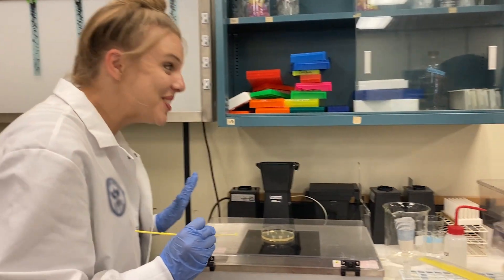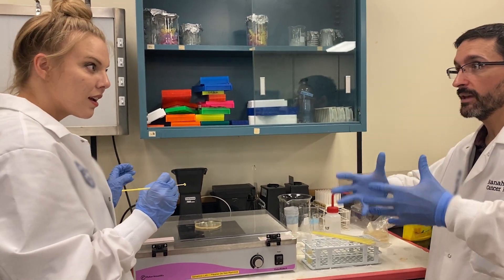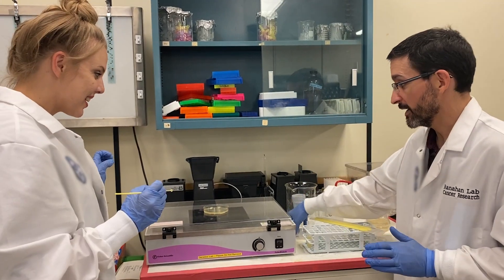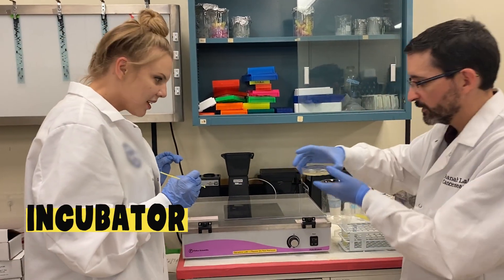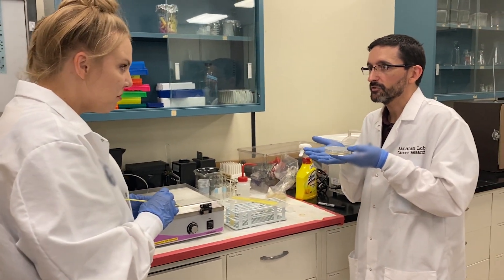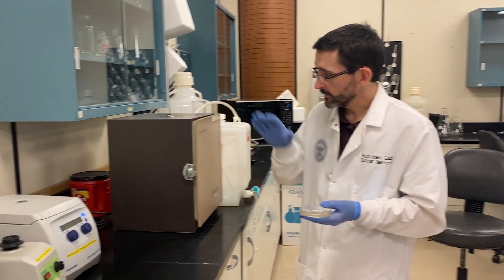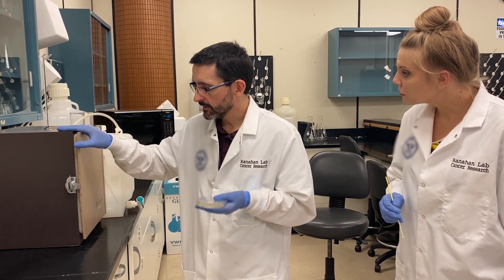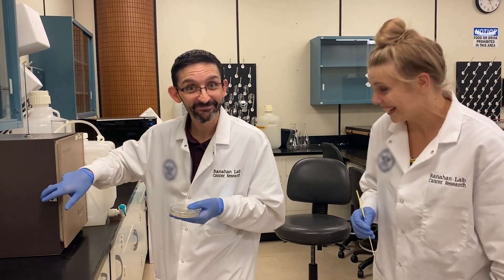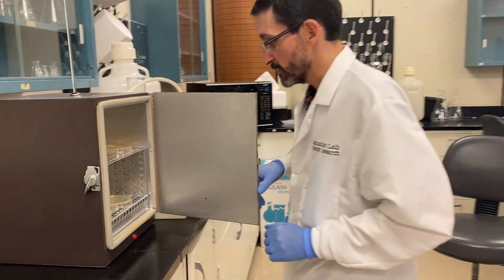Now they're going to grow, and then we'll make them glow. I think I'm done. What do we do now? Now we're going to let the cells grow. They replicate more of that DNA so it's nice and bright when we look at it. So now we've sent them in the incubator. We put the little cap on. It's kind of crazy, but we're going to flip it upside down, because they like it that way. So here is our incubator, and it's going to keep these cells nice and warm for us. They're going to grow overnight, and we'll take a look at them tomorrow.